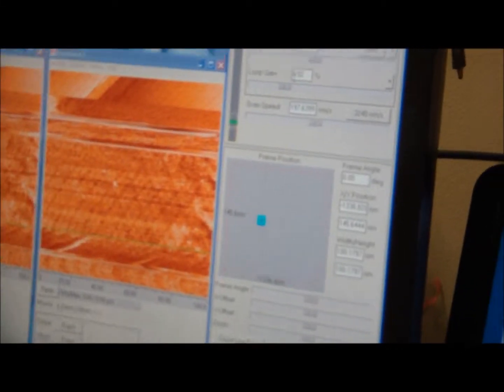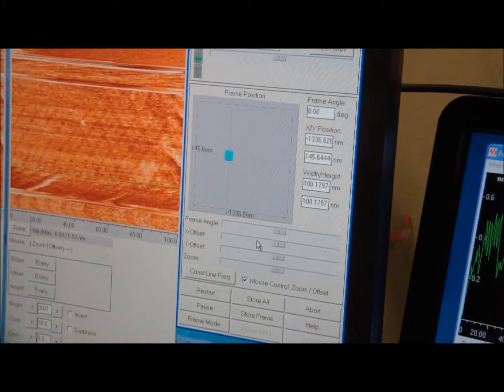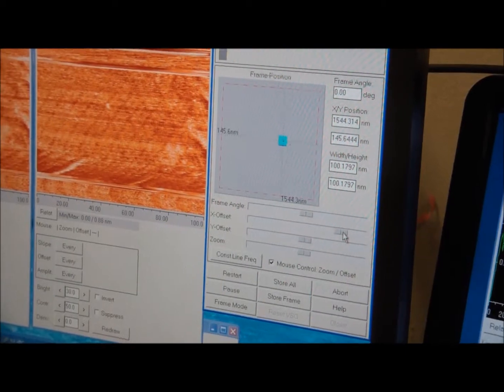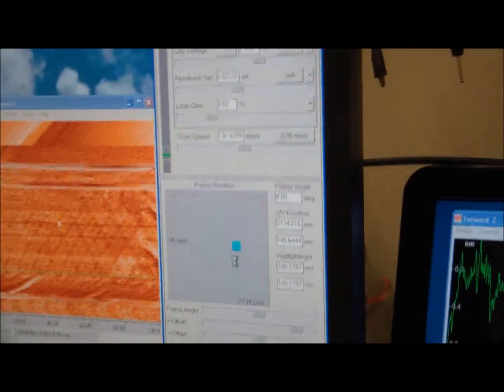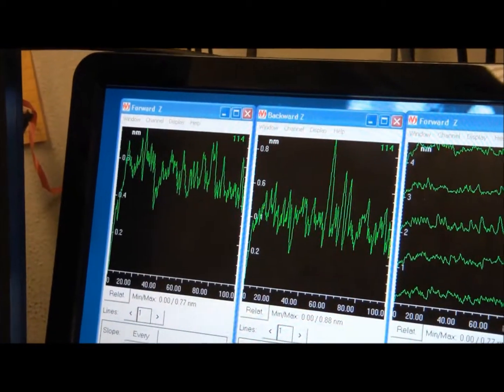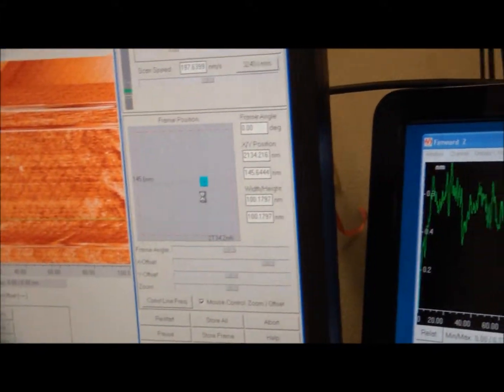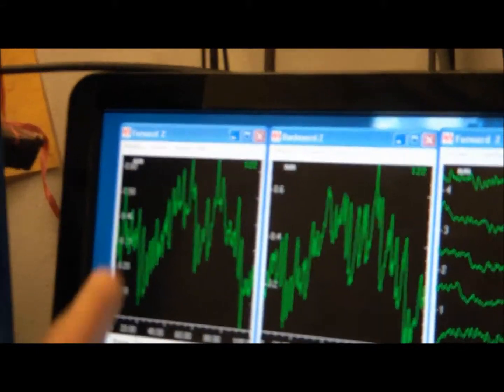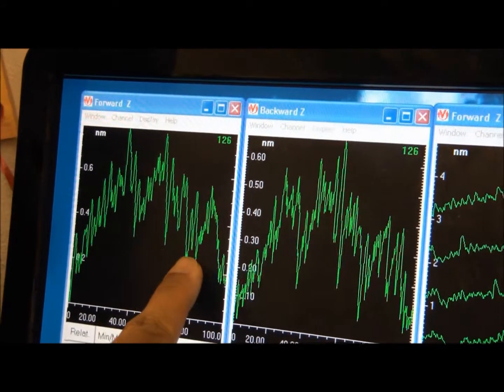An example of drift: concentrate on what I'm doing right here. I'm going to move the X very far. So there it is. I moved the tip very far away. And now what you should focus on is this graph right here. So it's moved and it's going to take some time to load. Okay. So as you can see, this thing is moving this way. As you can see it, right? It's moving.